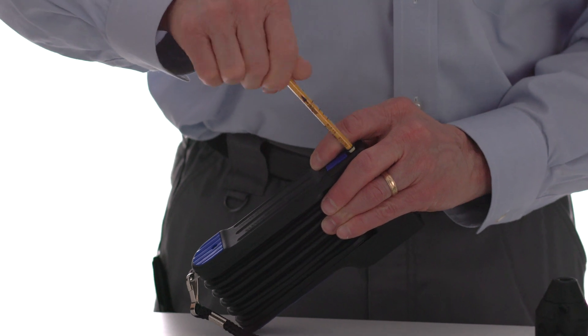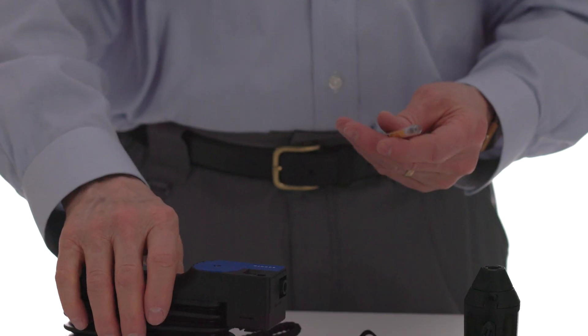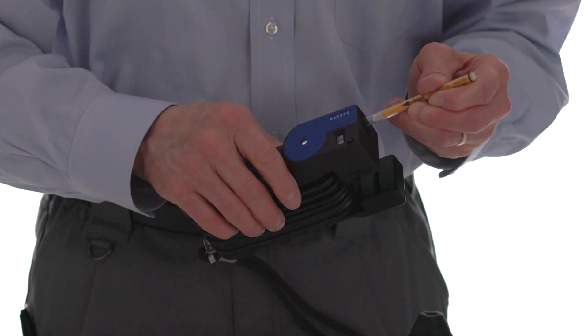The pump itself also has a cutter and tip breaker. Insert the tube into the pump inlet with the arrow pointing toward the pump.